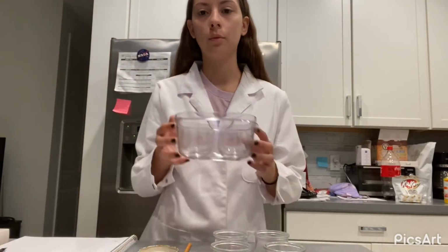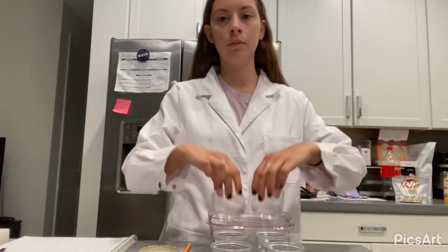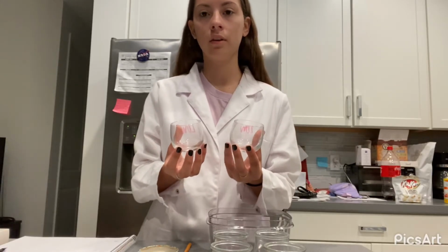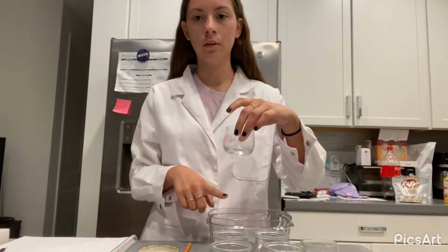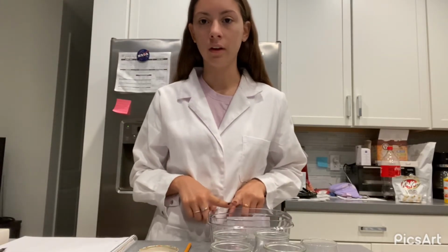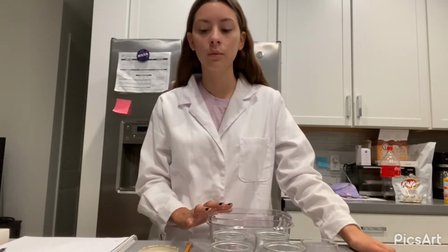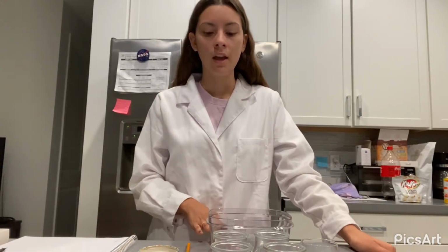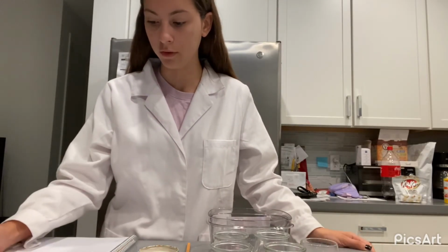Going back to our ice water bath, we have our 2 test tubes with different solutions inside. We're gonna remove them, and we're gonna put our hydrochloric acid into this sodium thiosulfate. Right now we're gonna start a timer, and we're gonna put it back into our ice water bath. We have our timer here, and as soon as it becomes cloudy, we're gonna record that time. So we stop the time, and we can see that it becomes cloudy at 182.4 seconds.